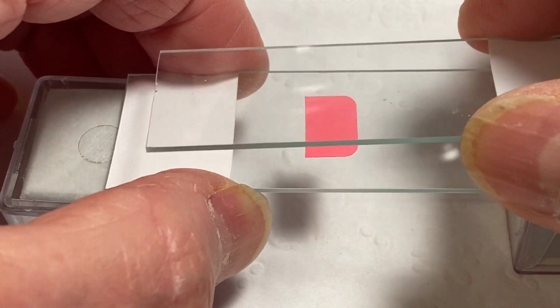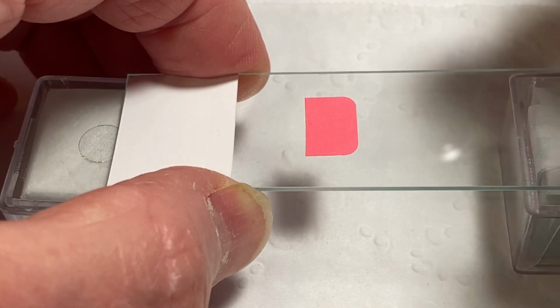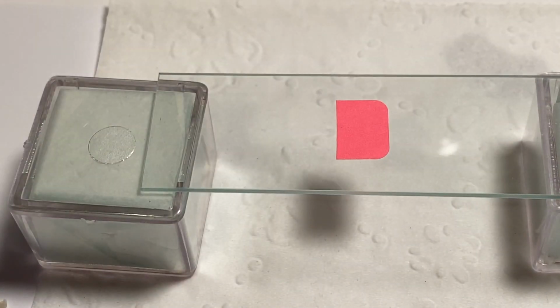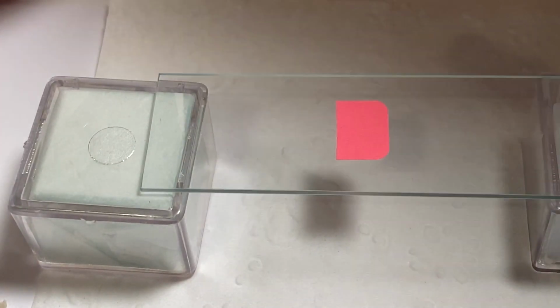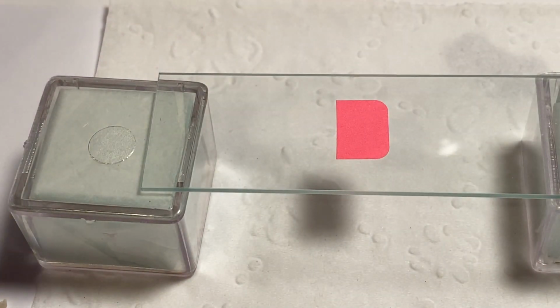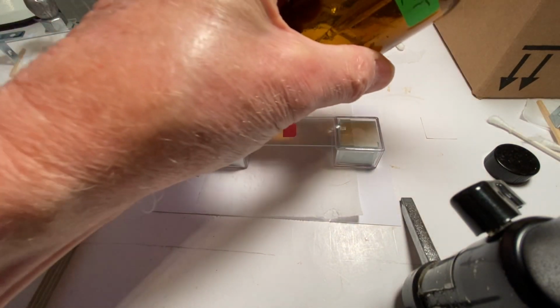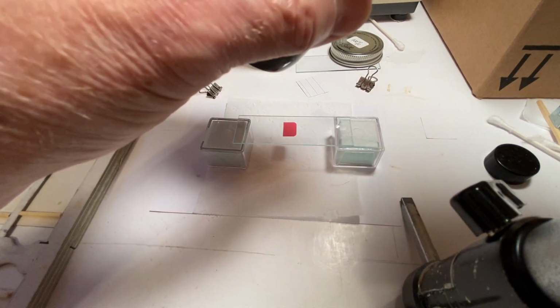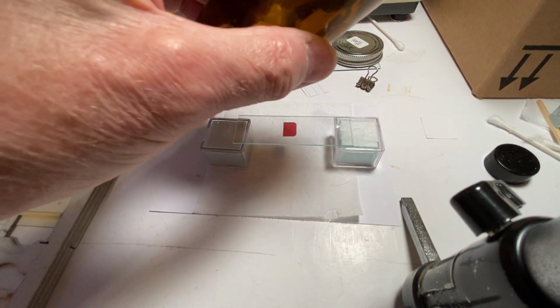So we're going to remove this. I know it's going to stick to the bottom one because the underside of that pink thing is sticky, and we're going to reveal the insect there on the bottom half. And it's important when we add the mounting medium, which in my case will be Permount by Fisher. Permount by Fisher is a well-known mounting medium. It's important to decant it into a smaller bottle because you don't want it to dry, of course, and because it'll make the medium thicker.